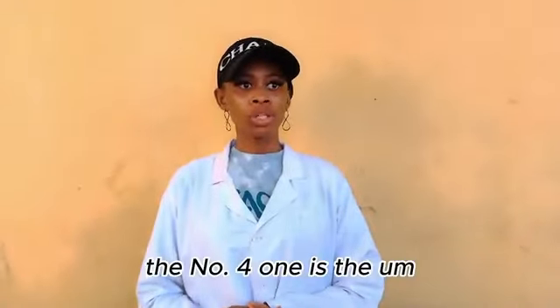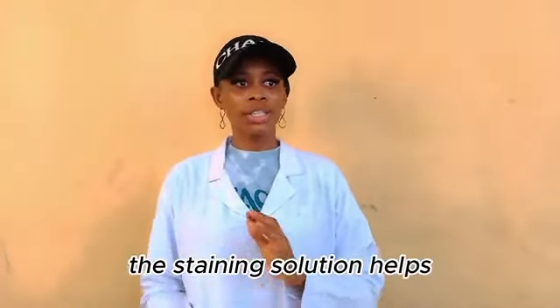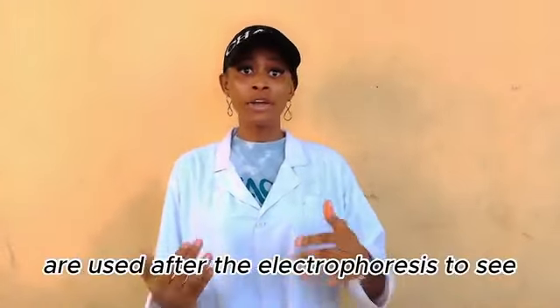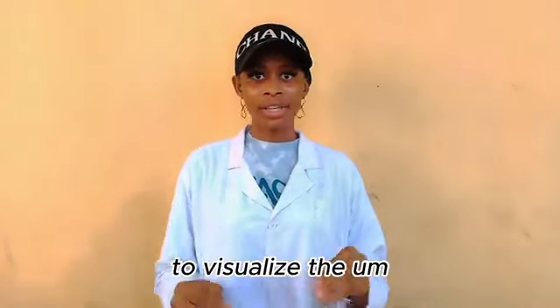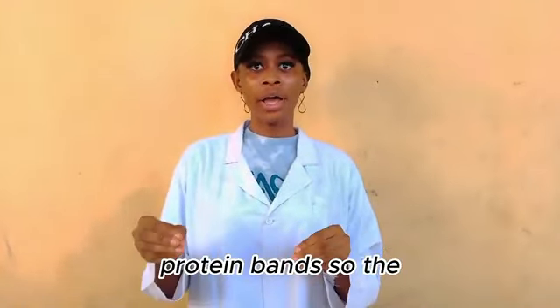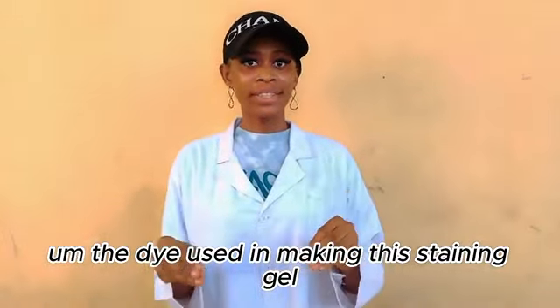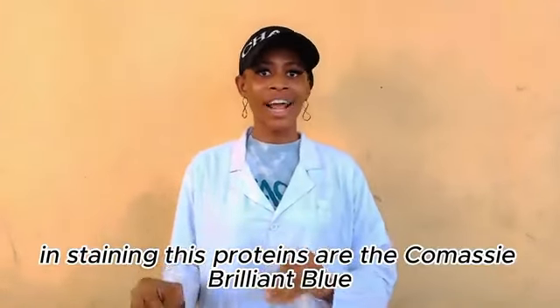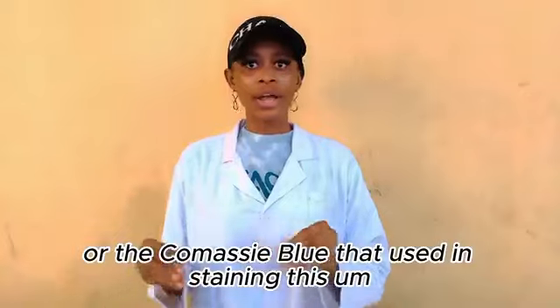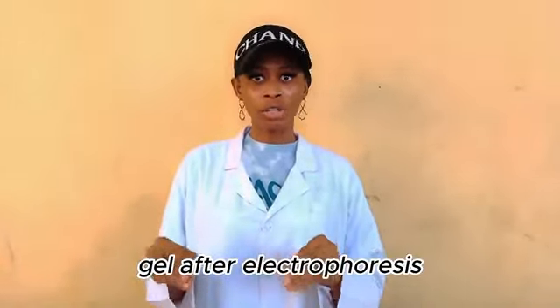Then the number fourth one is the staining solution. The staining solution is used after the electrophoresis to visualize the protein bands. The dye used in staining these proteins is the Coomassie Brilliant Blue or the Coomassie Blue. They are used in staining this gel after electrophoresis.